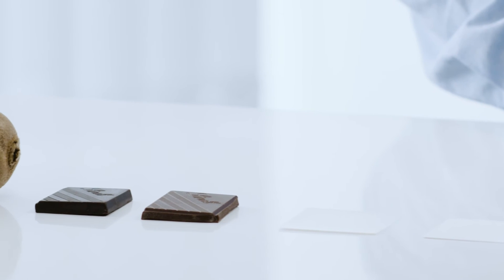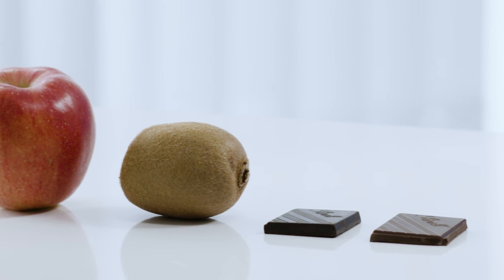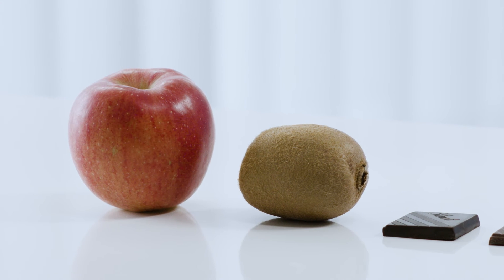Going even further up in the wavelength range towards shortwave infrared, it's also possible to measure the composition of different materials which make up an object. For example, we are measuring a kiwi and an apple based on their brix and dry matter content.